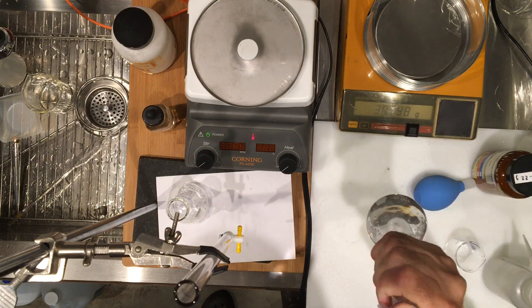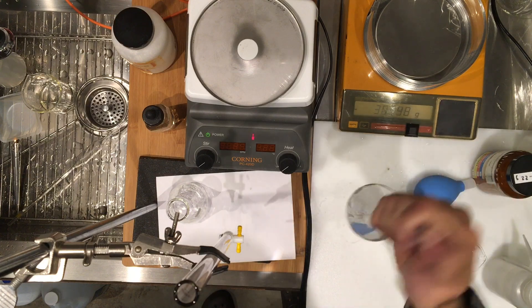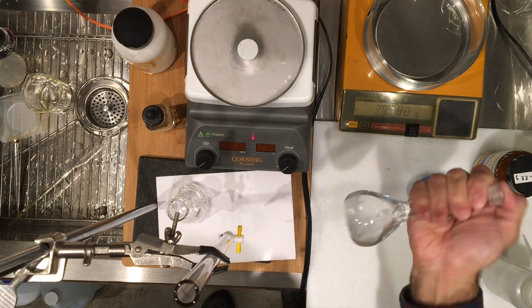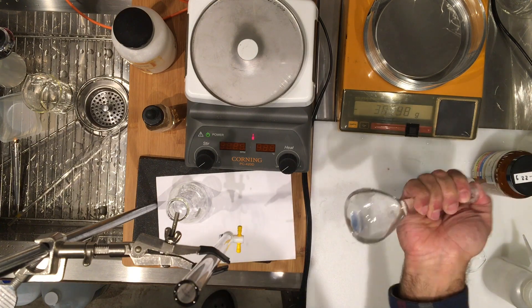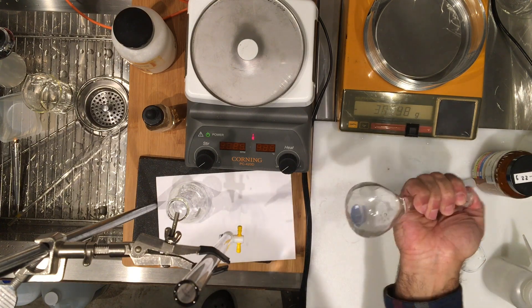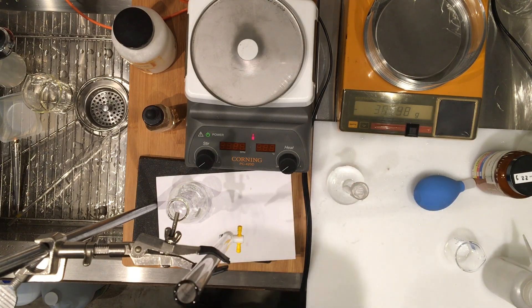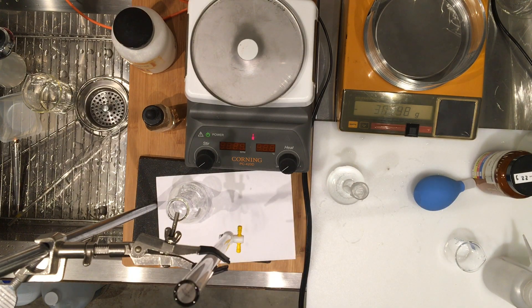Because I took 20.00, so the precision of the volume is actually 20.00 milliliter, I'm using a pipette with good precision. And the flask is 100.0 milliliter volume, so my volumes are all in 4 sig fig.